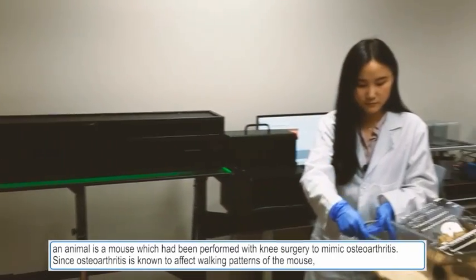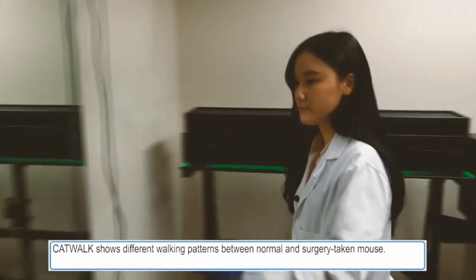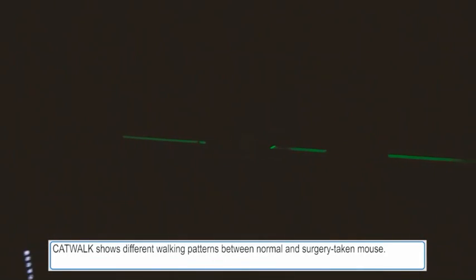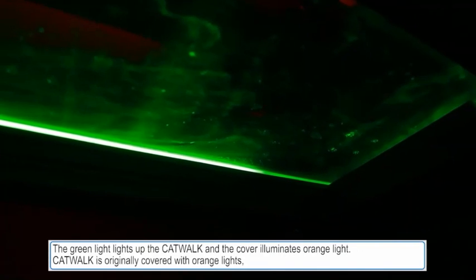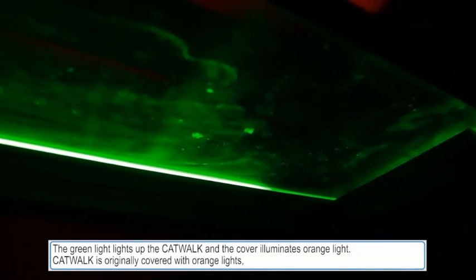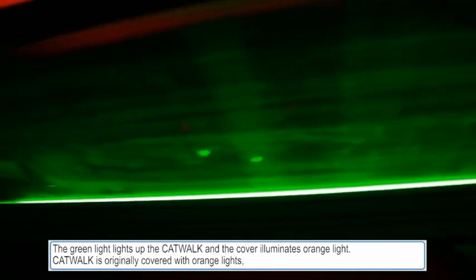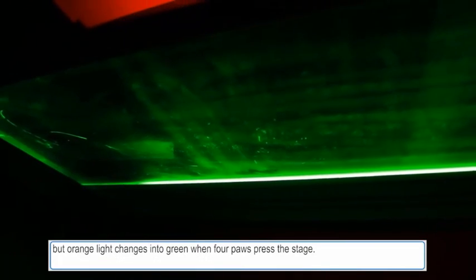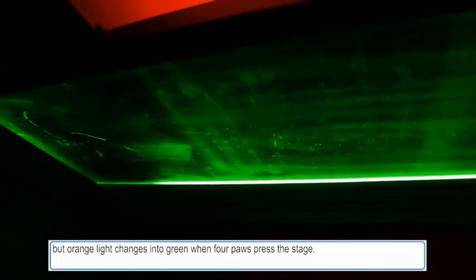Since osteoarthritis is known to affect walking patterns of the mouse, CatWalk shows different walking patterns between normal and surgery-treated mice. The green light illuminates the CatWalk, and the cover illuminates orange light. CatWalk is originally covered with orange light, but it changes to green when paws press the stage.